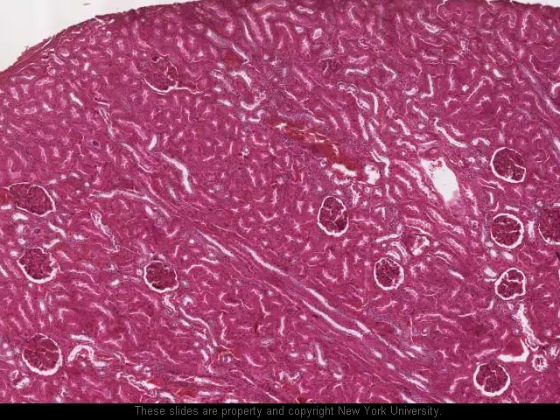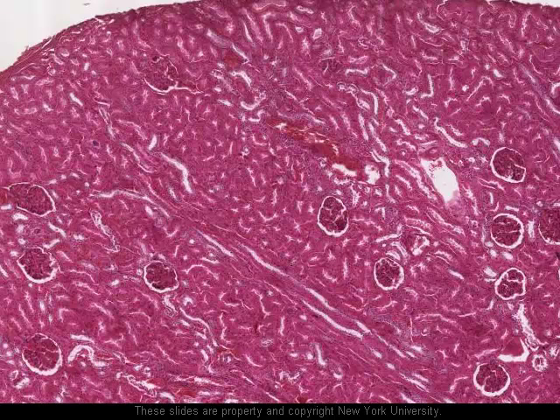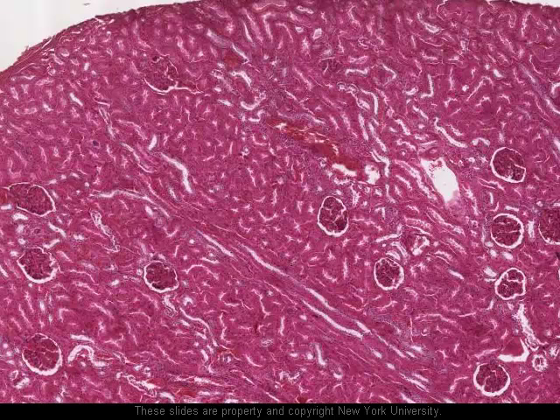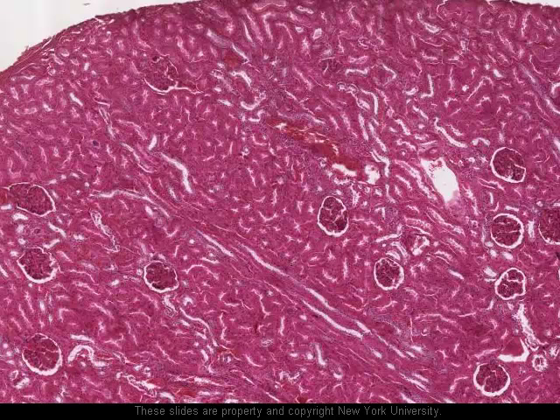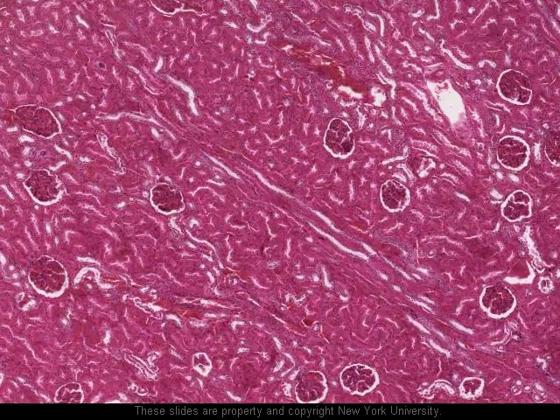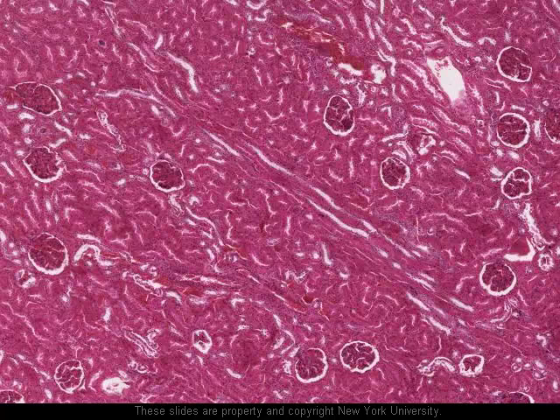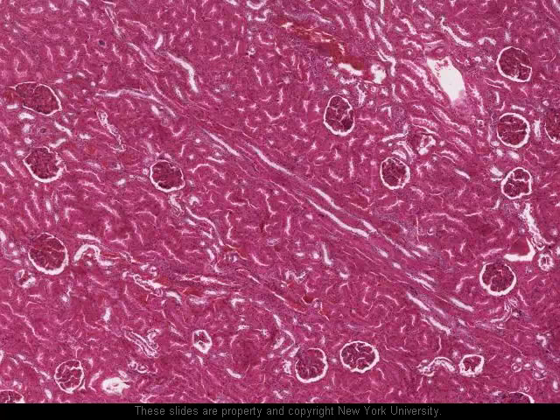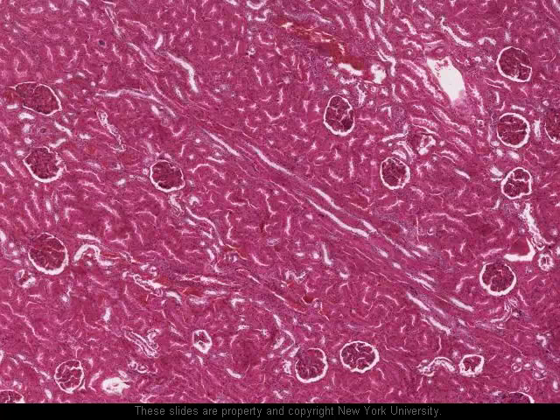In the cortex there are regions in which we can see stripes, or striations, or ray-like structures. These are they here, and these are tubes cut in longitudinal section, and these give rise to the appearance known as medullary rays. In this instance, medullary ray means a ray or a collection of tubes oriented longitudinally which are extending into the medulla, and it's not actually part of the medulla that's found in the cortex.